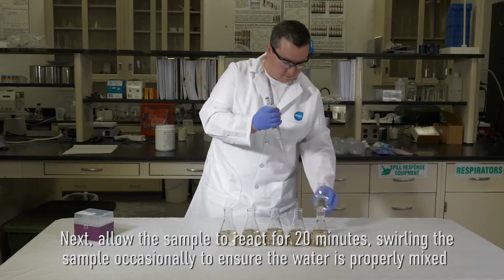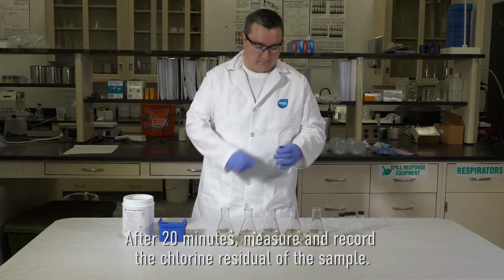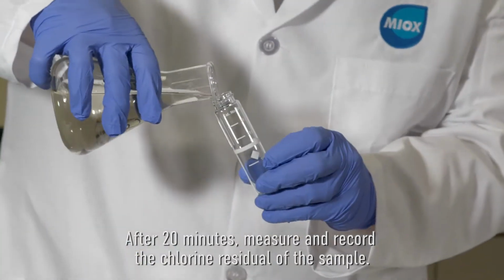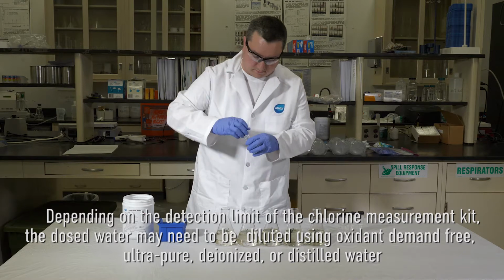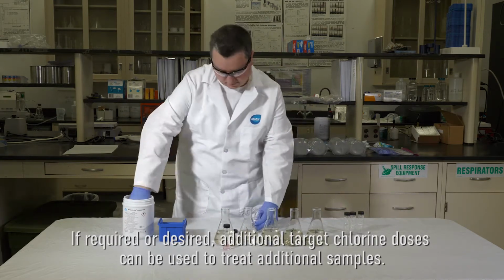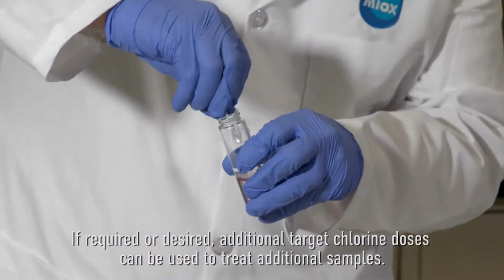Next, allow the sample to react for 20 minutes, swirling the sample occasionally to ensure that the water is properly mixed. After 20 minutes, measure and record the chlorine residual of the sample. Depending on the detection limit of the chlorine measurement kit, the dosed water may need to be diluted using oxidant demand-free, ultra-pure, deionized, or distilled water. If required or desired, additional target chlorine doses can be used to treat additional samples.